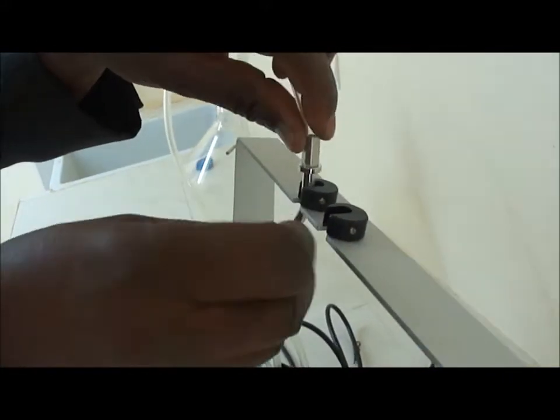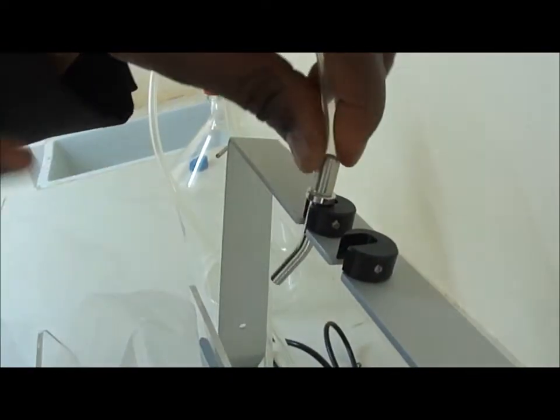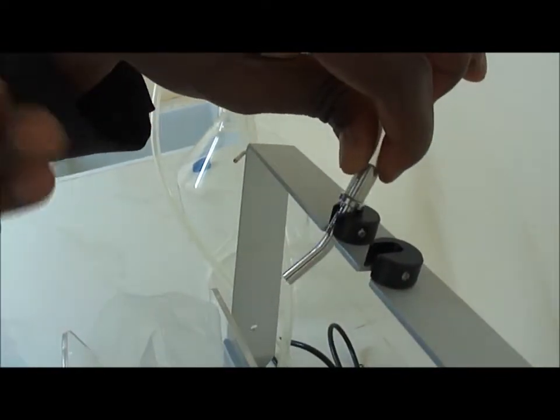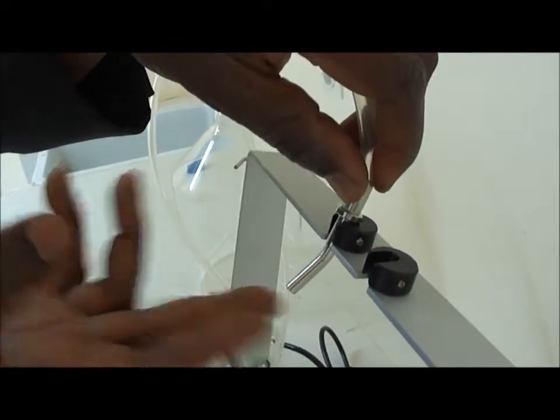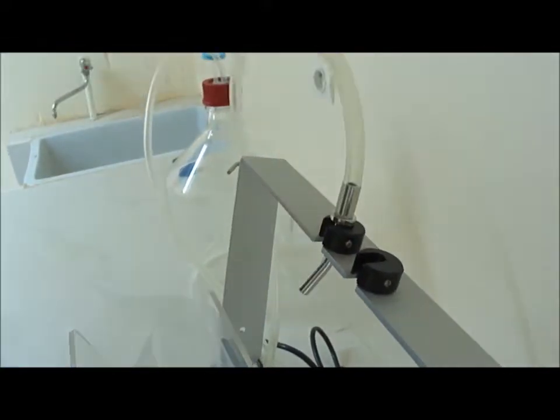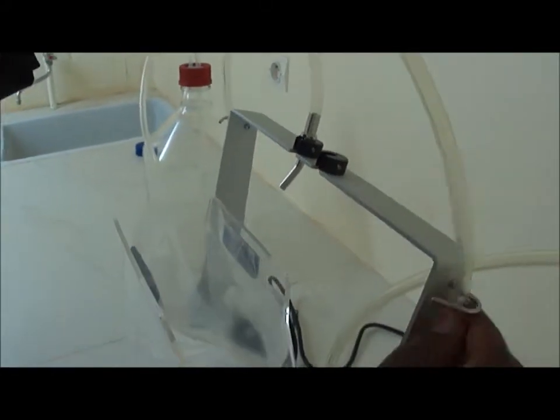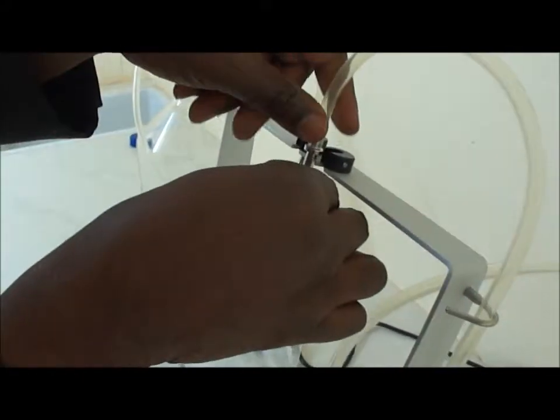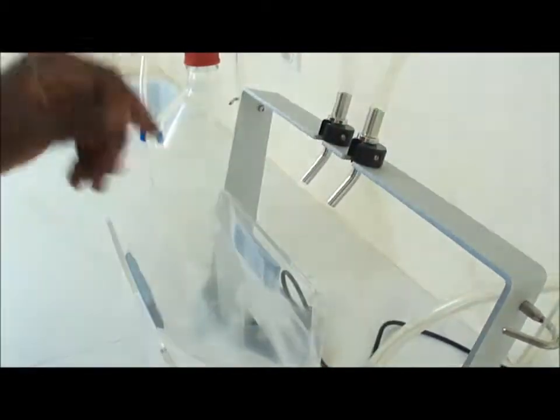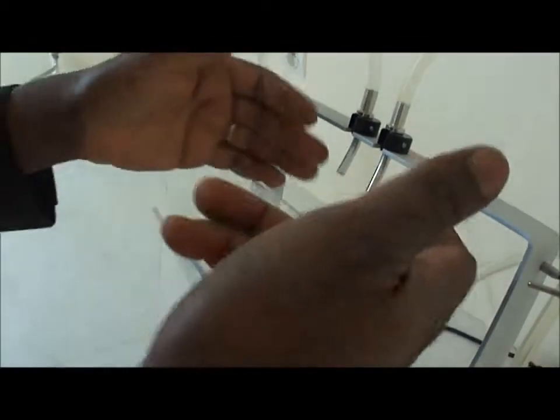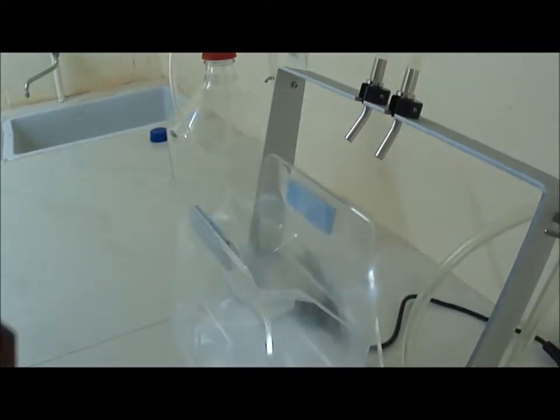We put this on the top here with the elbow directed at the back so that the opening will be on the front. You just insert this and pass also this here, and then you insert here. One can see that if it's on the back here, it's not directed to the interior of the plastic bag.